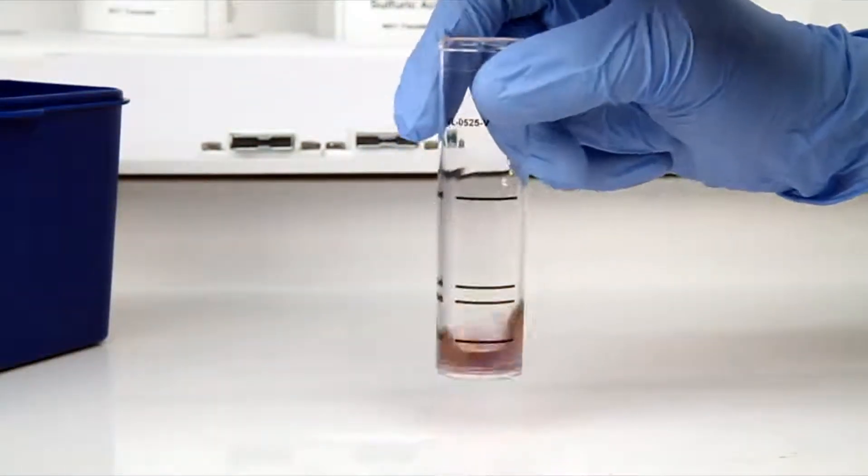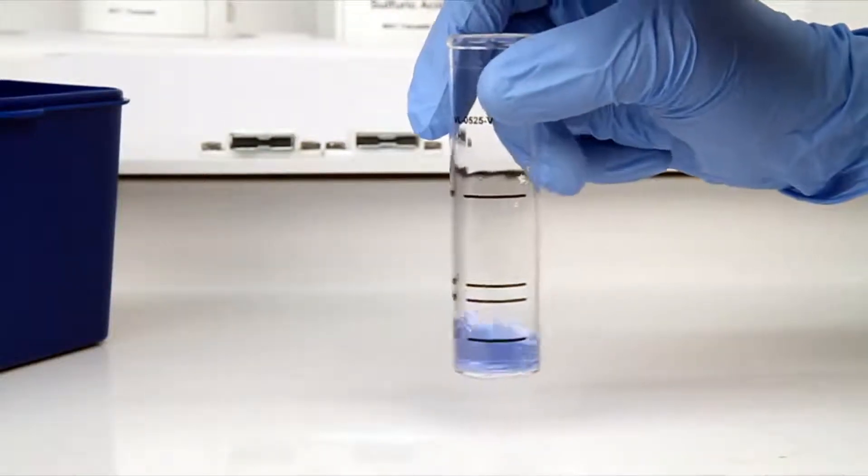According to the endpoint ID procedure, the titration is complete when the sample changes from orange to blue.